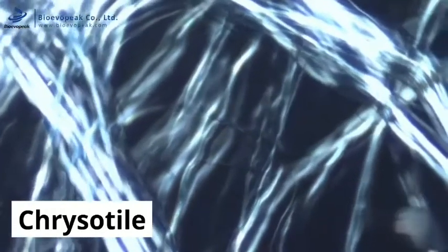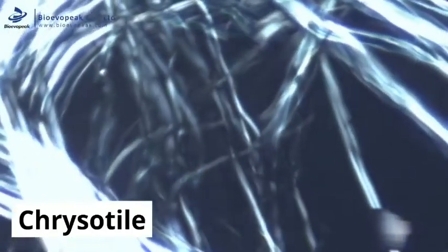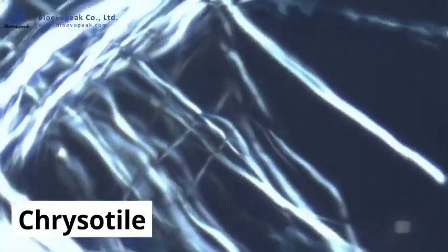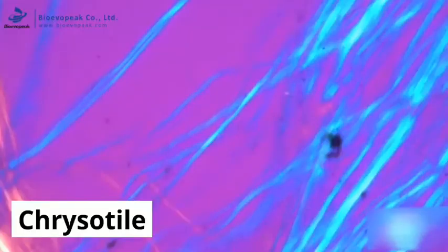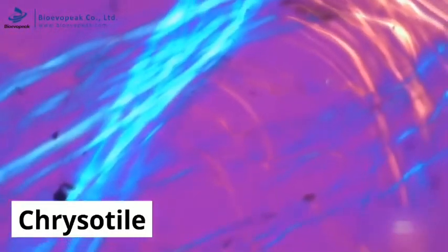Next is the birefringence and extinction. The fibres again appear and disappear, indicating a mineral, but the fibres don't glow quite as brightly as the amosite fibres did. The sign of elongation is assessed next with the pink background and should show the fibre as blue when in a northeast to southwest orientation. This indicates the light travels slower down the length of the fibre than across the width. This would be the case for all fibres except crocidolite.